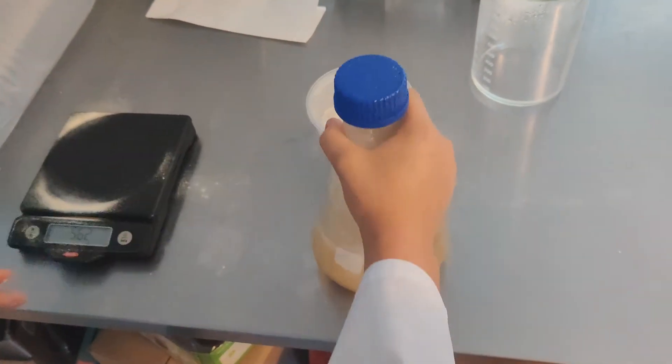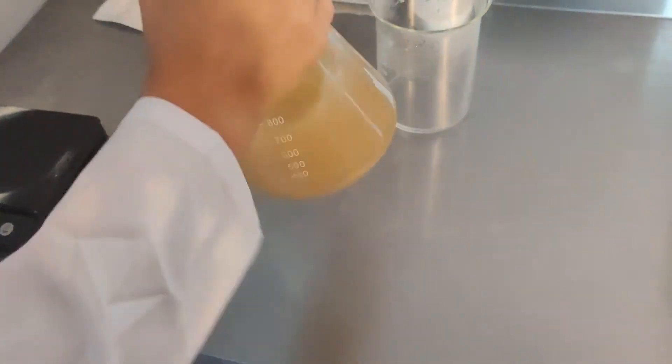Give your malt extract agar solution a good stir to dissolve everything.